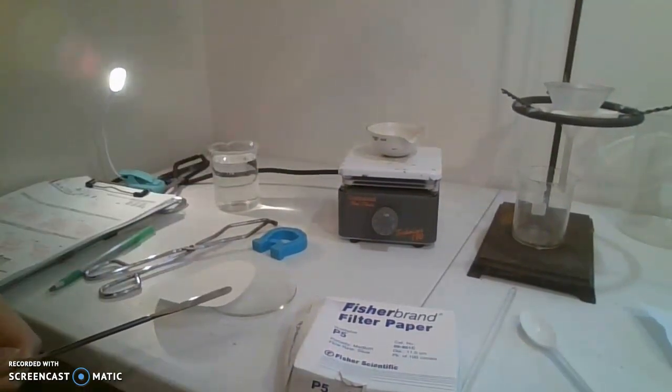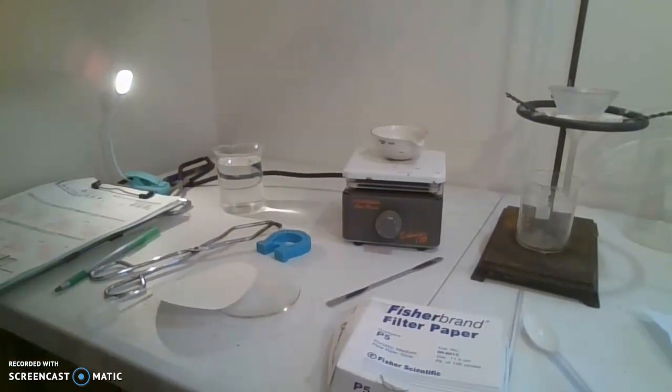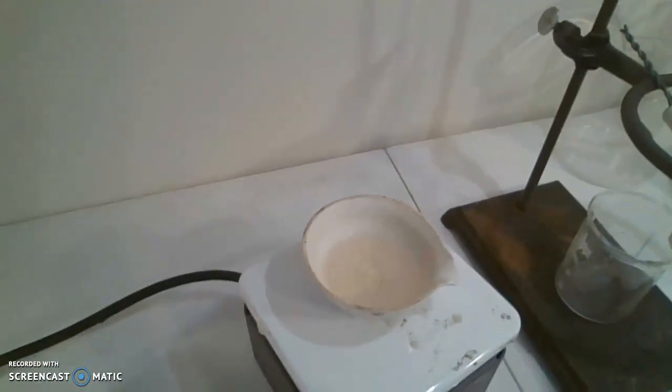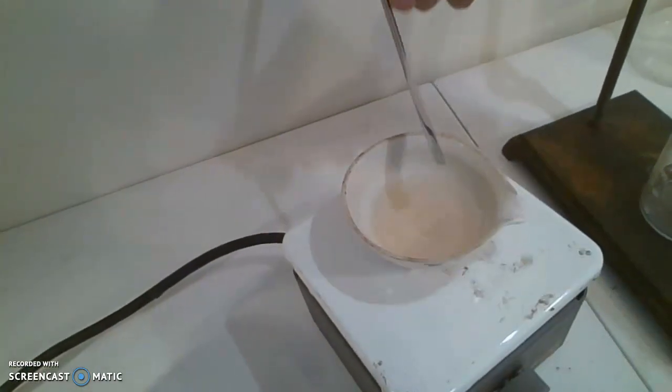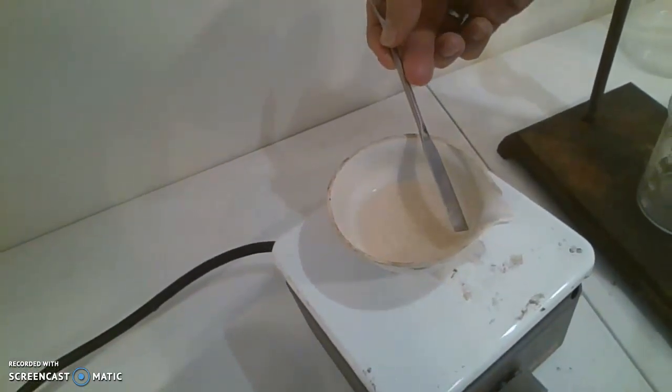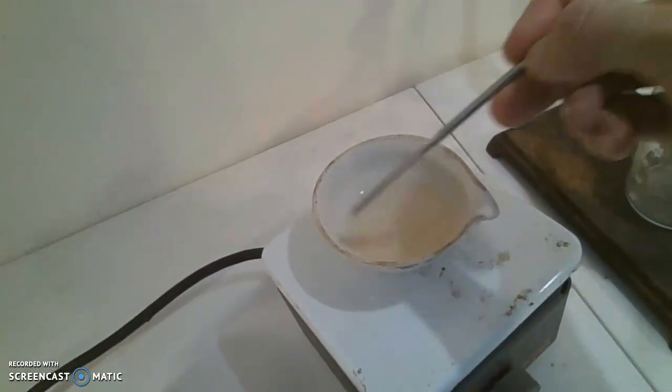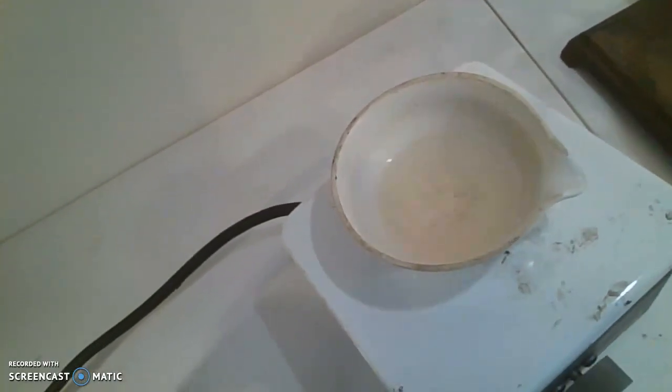Now we are at 16 minutes and you can start to really see these salt rings forming around the outside. I'll try my best to capture that on the video for you. Here is one big ring of salt, another big ring of salt, and it's just going to continue.